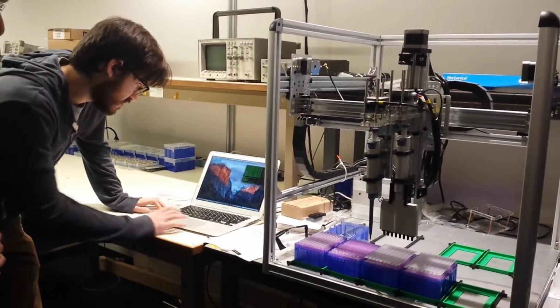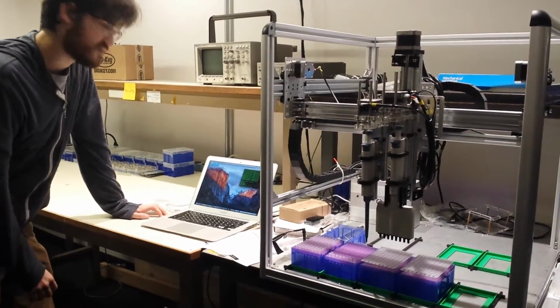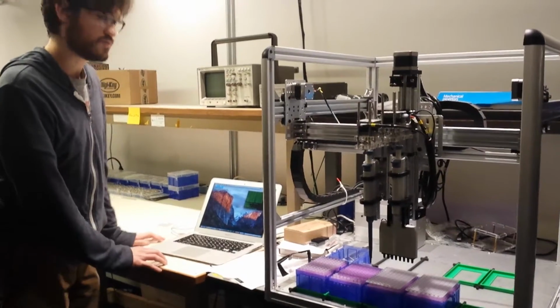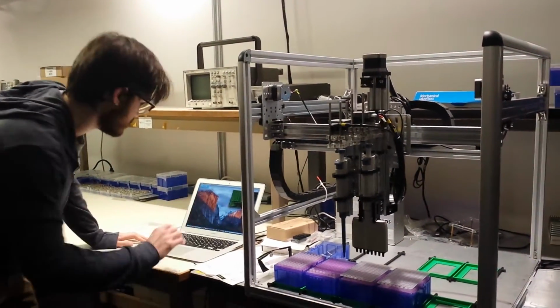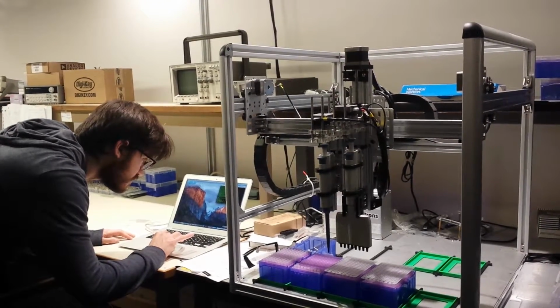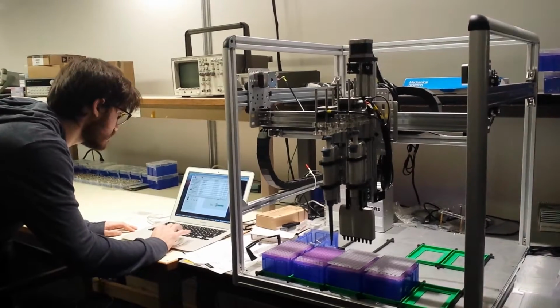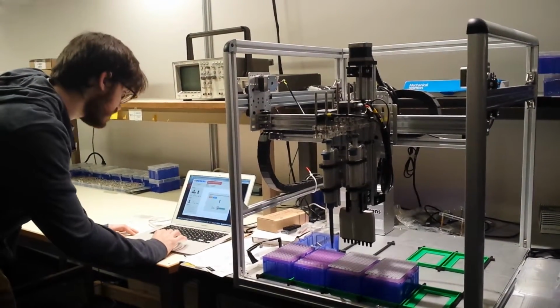So this is saying that the message you wrote was 352 bits. It's going to take 59 DNA molecules to write it, so 59 transfers over here. Just going to upload this instruction.